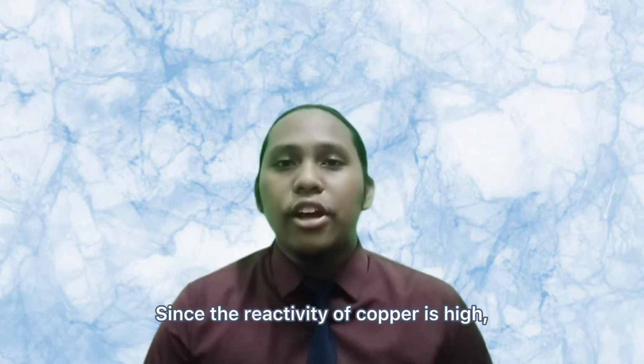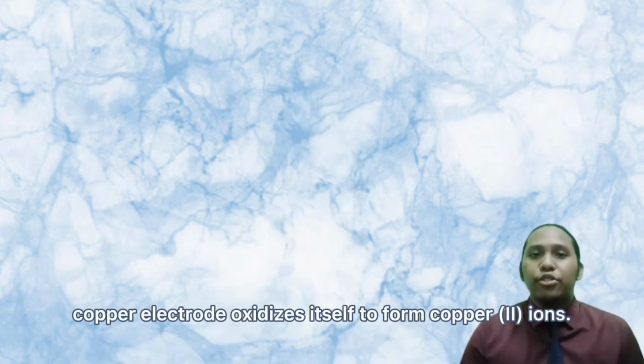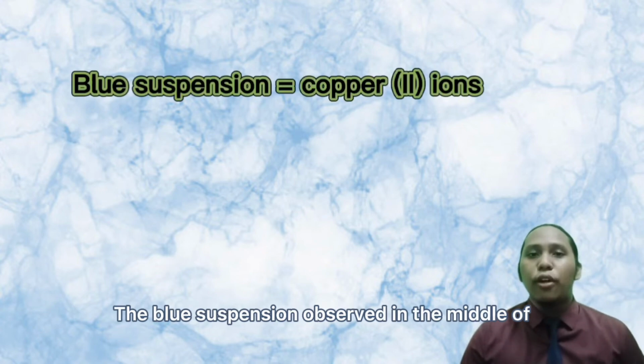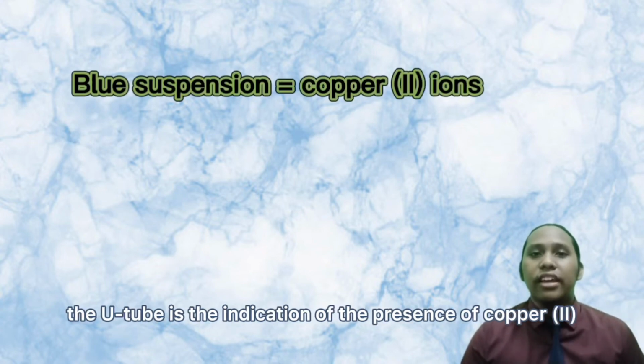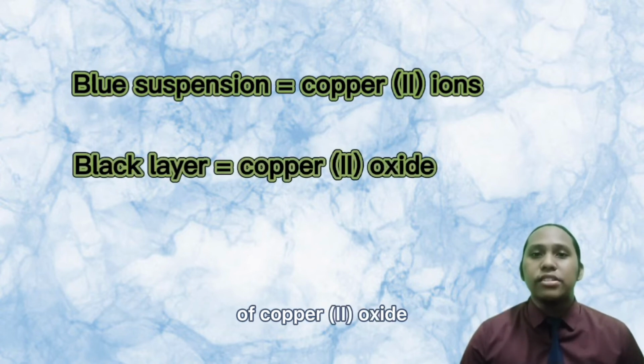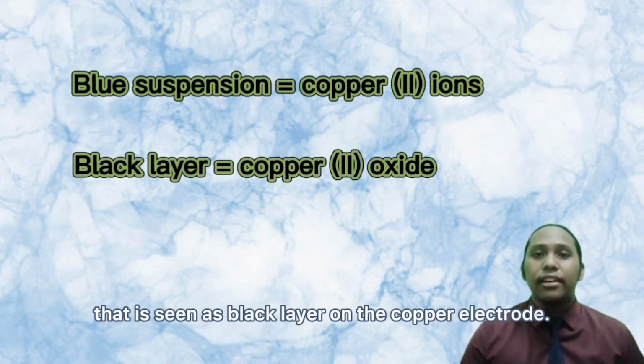Since the reactivity of copper is high, the copper electrode oxidizes itself to form copper-2 ions. The blue suspension observed in the middle of the U-tube is the indication of the presence of copper-2 ions in the bulk solution. Oxidation of copper also results in the formation of copper-2 oxide that is seen as a black layer on the copper electrode.